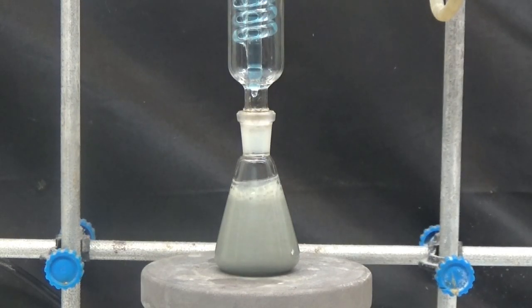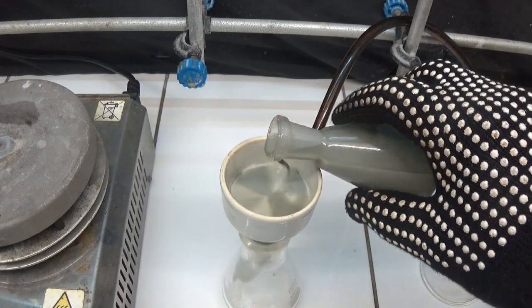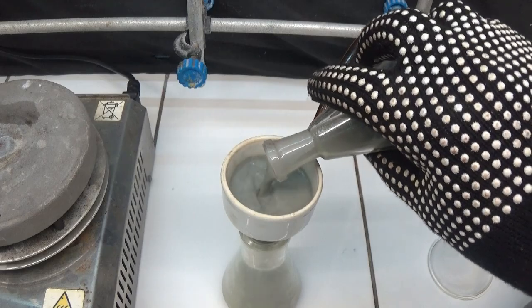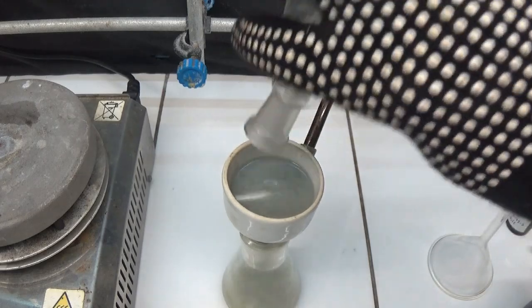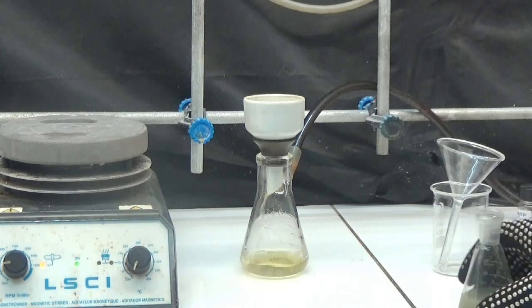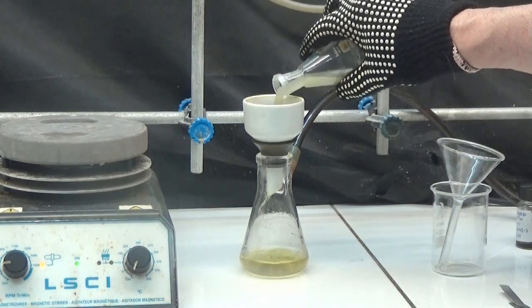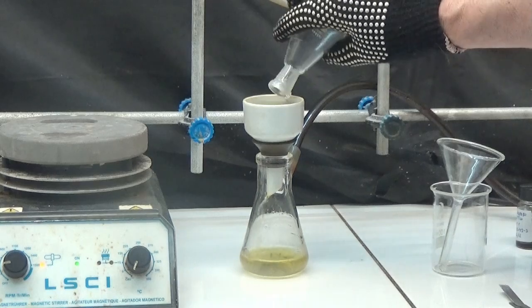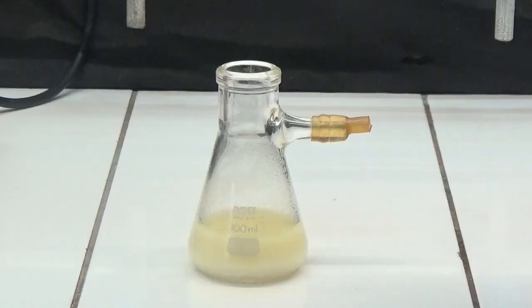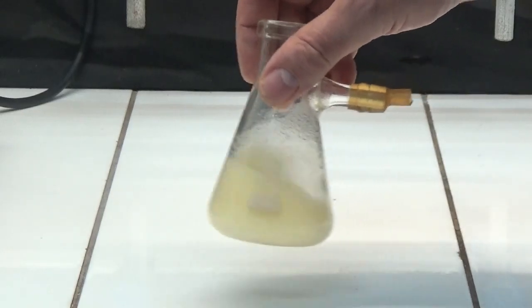After refluxing, filter hot over a filter paper in a Buchner funnel. Wash the solid in the funnel with 10 ml of 96% ethanol. Allow the filtrate to cool and the purified nifedipine appears.